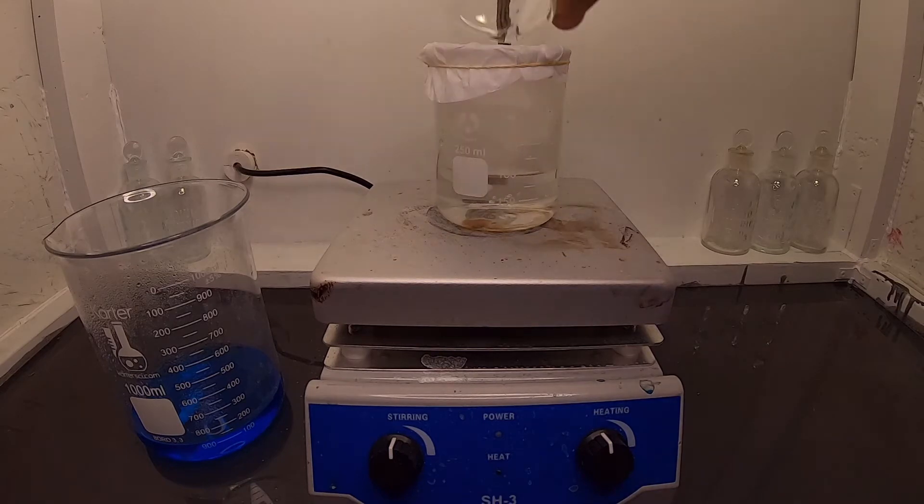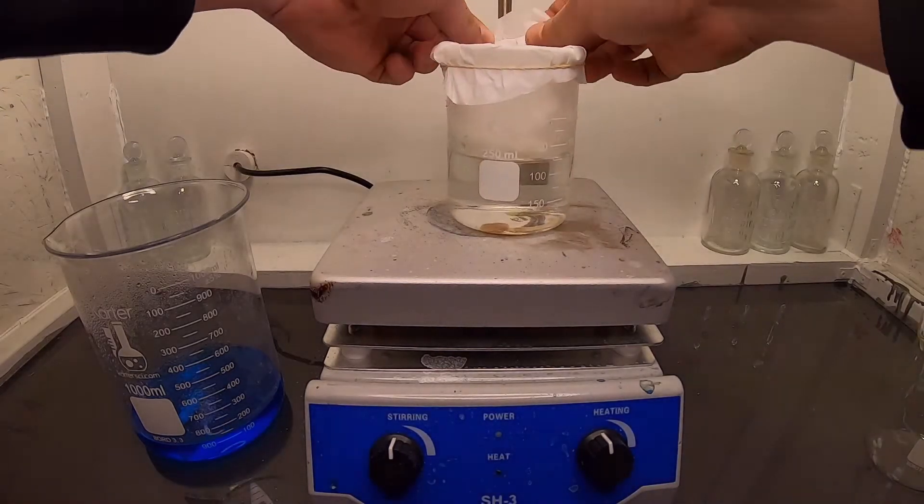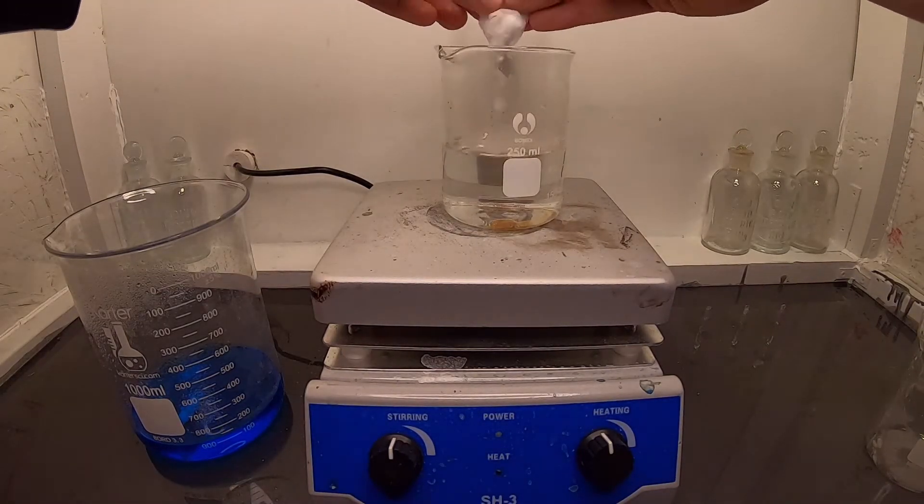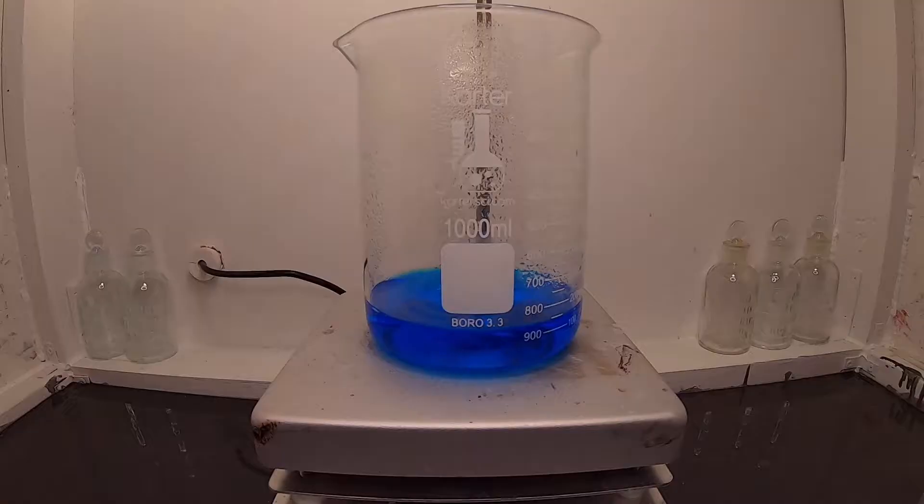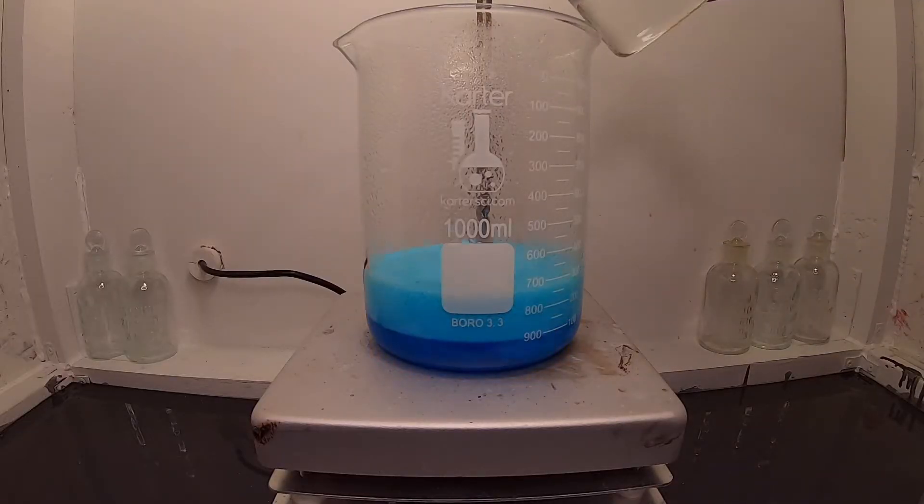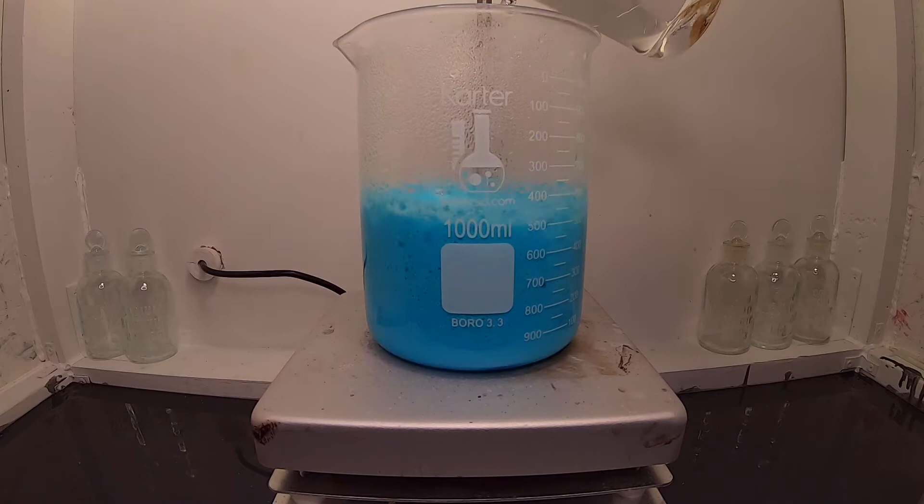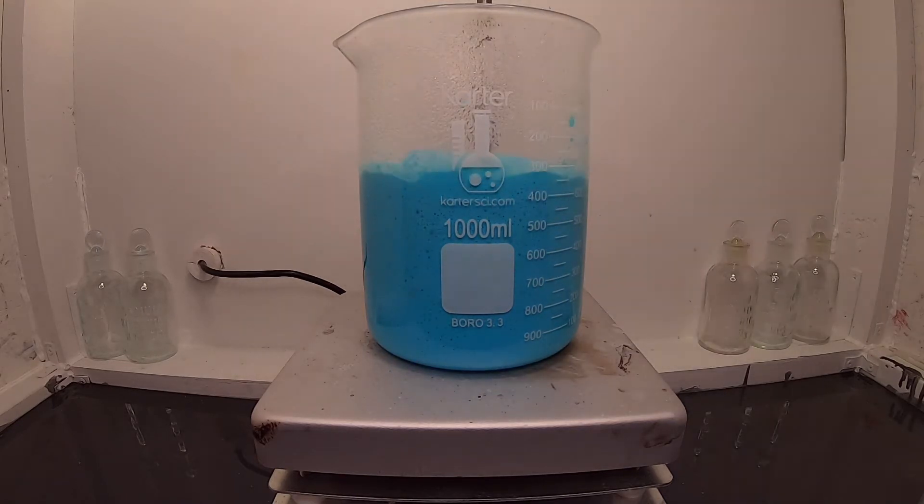I quickly filter the sodium carbonate solution because I see some crud floating around. When these two solutions are fully dissolved and combined together, copper carbonate and CO2 gas are created, along with sodium sulfate.